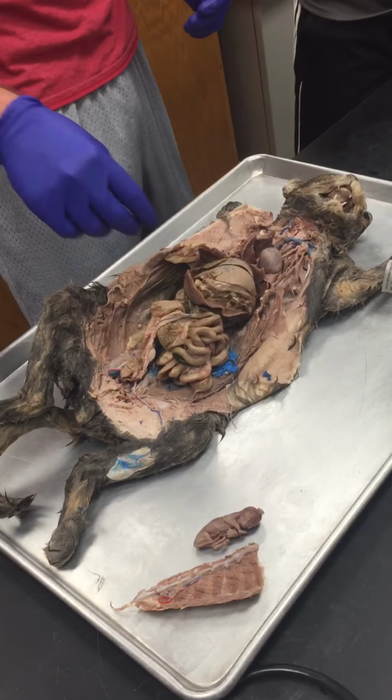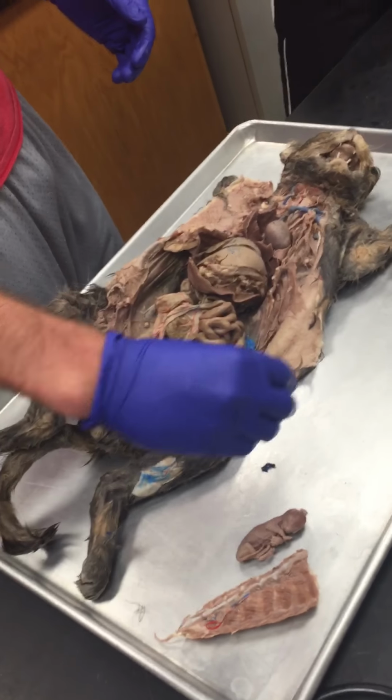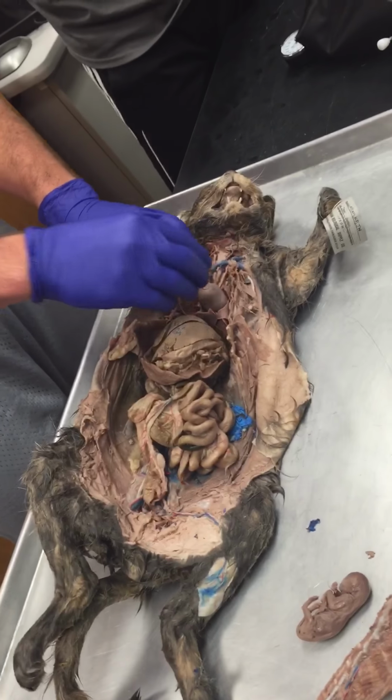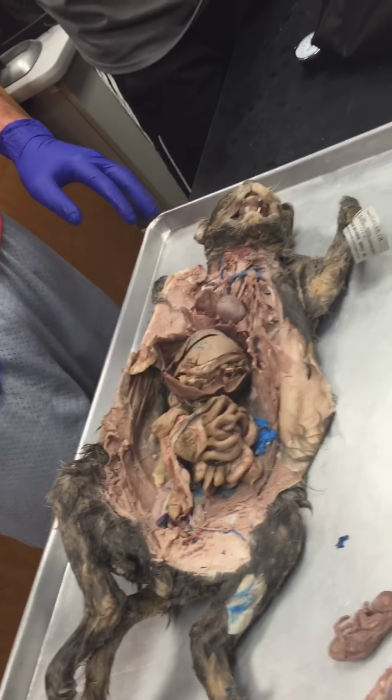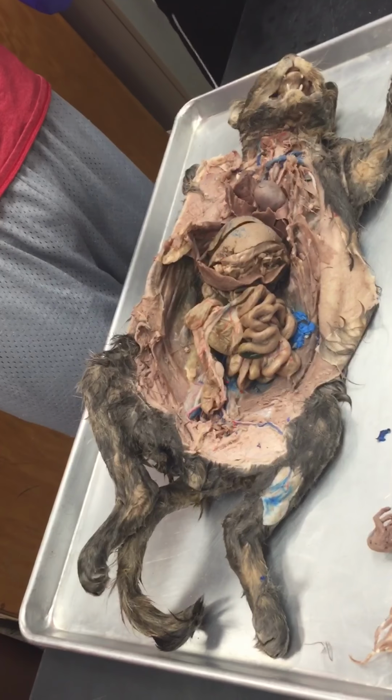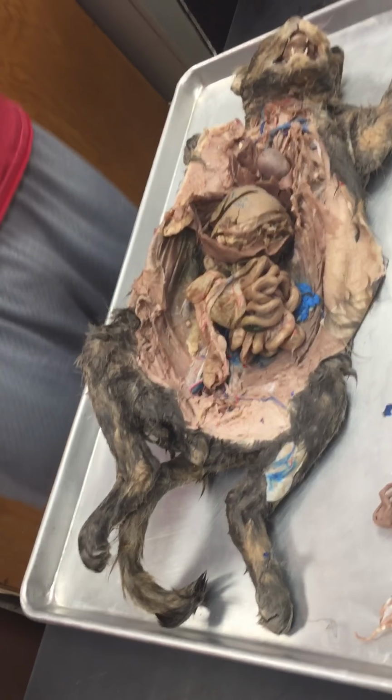Through, and then I'll come back and do veins. I was giving birth. Aw, you picked this one? Oh yeah. Do y'all have a probe or anything? Does anybody have a little probe laying around? A little metal stick that I was using? Here? Yeah, let's do that.